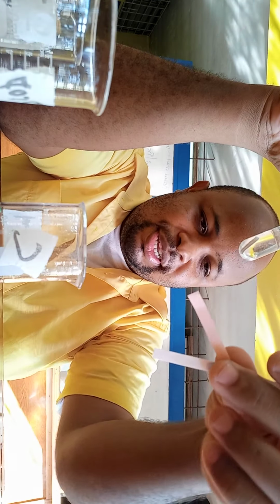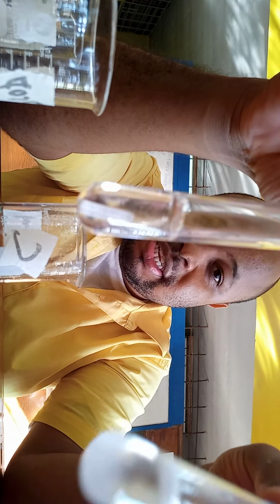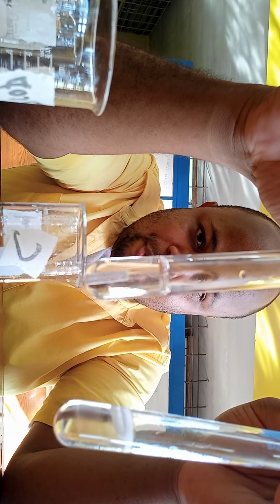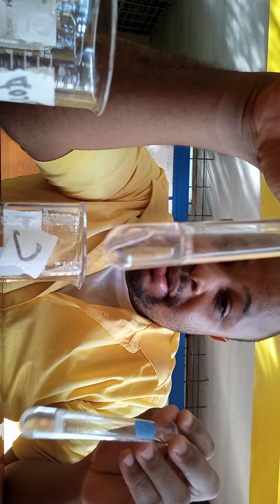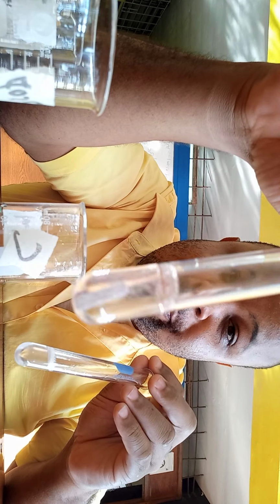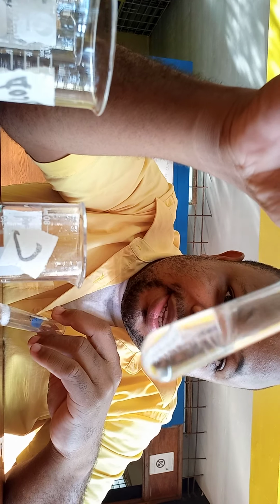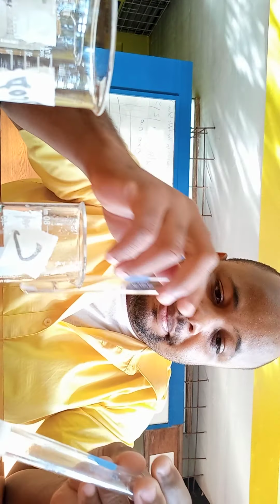Let me not, well, I'm not sure which two they were. They're mixed up now. Right, but if you oxidize a primary and a secondary alcohol, then you add magnesium metal, not so convincing, alright? Both of them react the same. But based on our experiment here, we see that the primary alcohol, which would have been oxidized to the carboxylic acid, reacts slowly with the metal, which is what is expected.